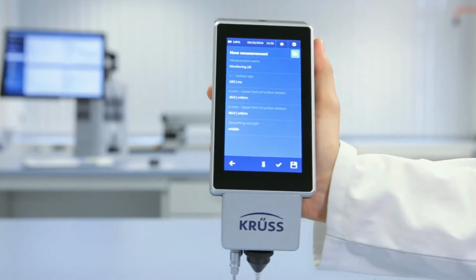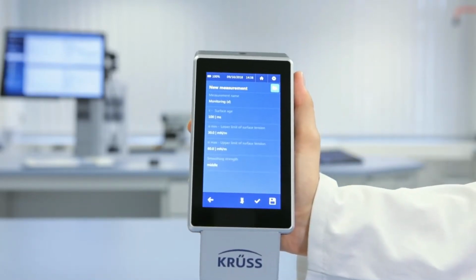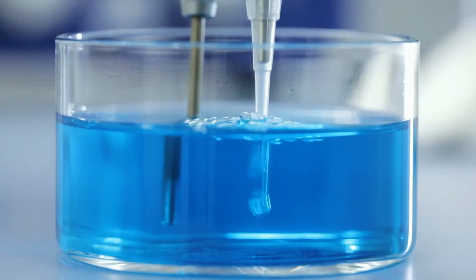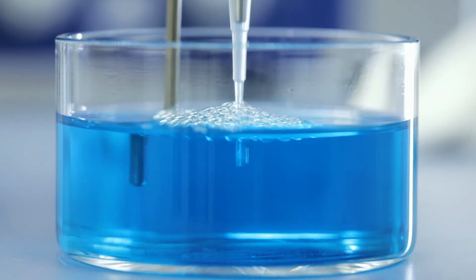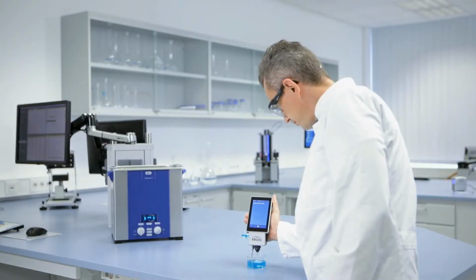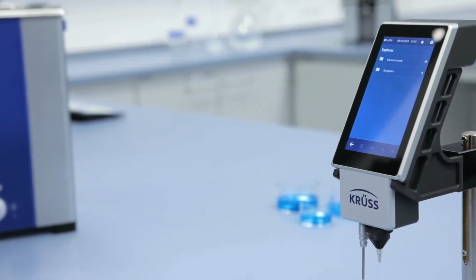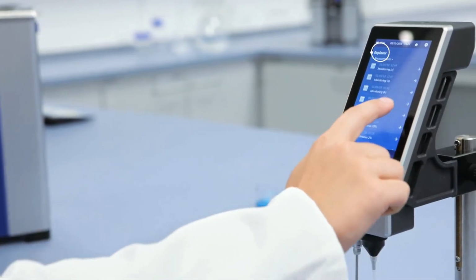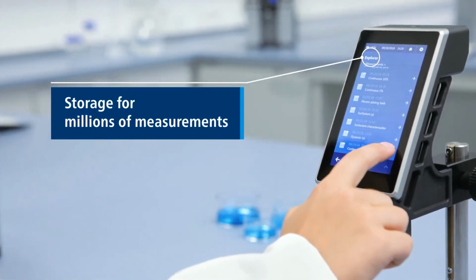The instrument also takes precise measurements while held by hand thanks to the intelligent pressure control, making it essentially independent of the depth to which the capillary is immersed. This virtually eliminates variations which result from different people using the unit. Thanks to the large, built-in storage, the instrument provides practically unlimited space for millions of measurements.